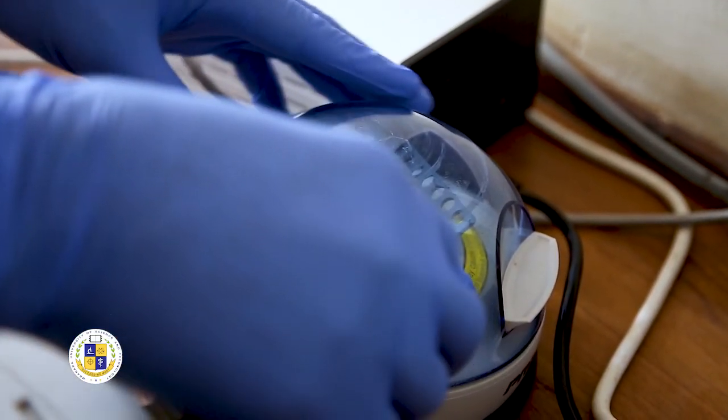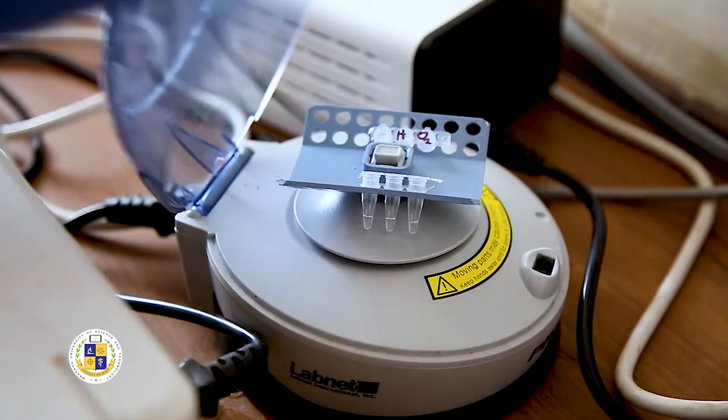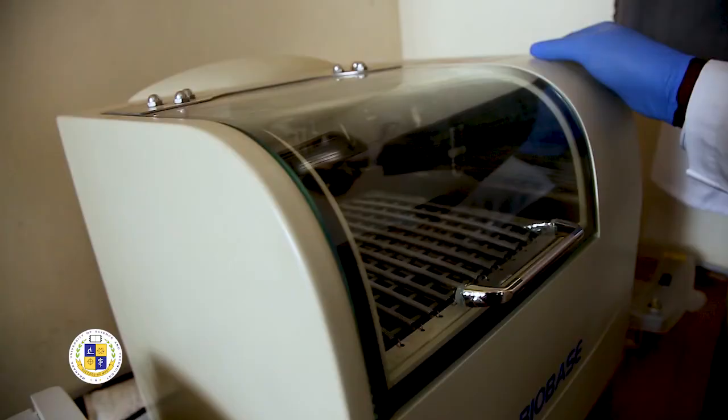As a department, we have many sections. We have this section where we are sitting today, which is the genomics and translational laboratory. Here we go deep not only to look at the organism in the microscope, but we go to break it down to what makes it up — what people have called the DNA. This helps us understand these organisms better. You have heard about the different variants of COVID — the London variant, the Hong Kong variant. It's because they look at their genetic makeup and see the difference at that level. So this lab is able to help us do that.